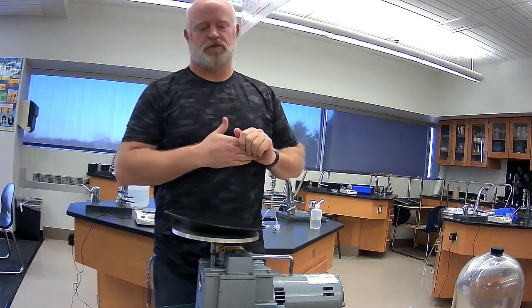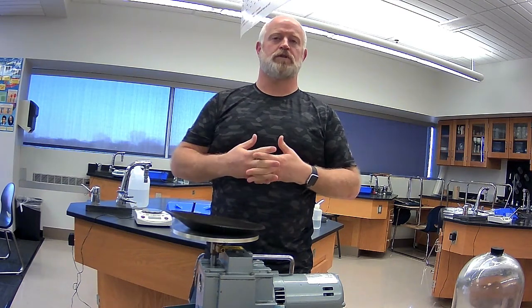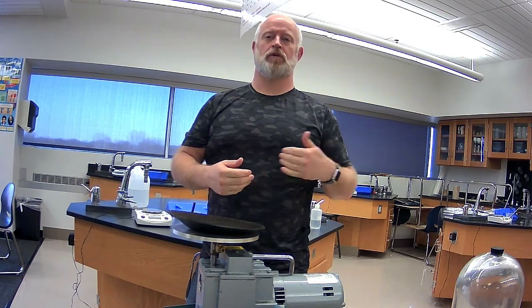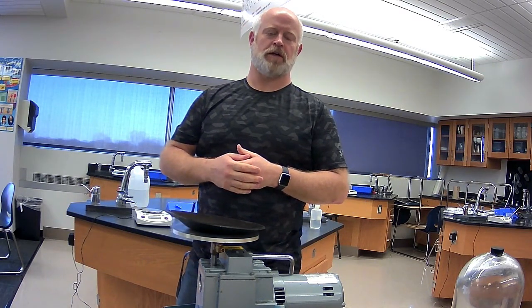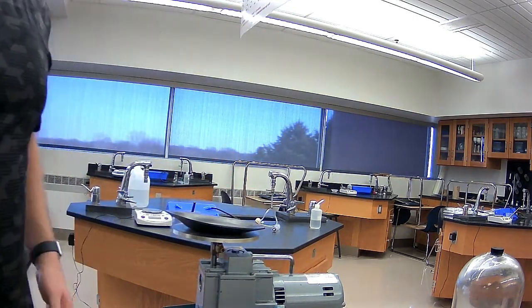Okay, in this little video demonstration, we're going to take a look at Henry's law, which relates to the solubility of gases dependent on pressure. Okay, so in our notes, we've already talked about that relationship, but now we want to see it in action. So to do that, I have a couple of things for us here.